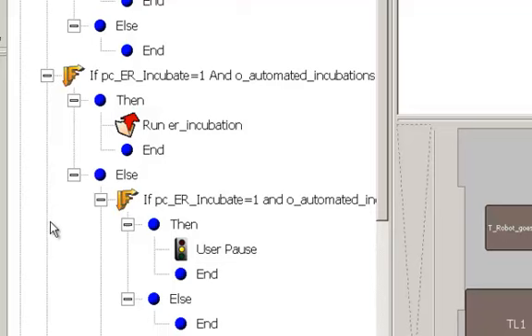We can change the elution volume in that ampure procedure. We can change the sample volume going into that ampure procedure, but it all calls the same ampure procedure. So it makes maintaining the method easier. You only have to go change that one step if you're going to tweak it, and it will tweak it in all 4 places, or all the places that it's called in the method. There are advantages to that and disadvantages, but that's the way this method was developed.